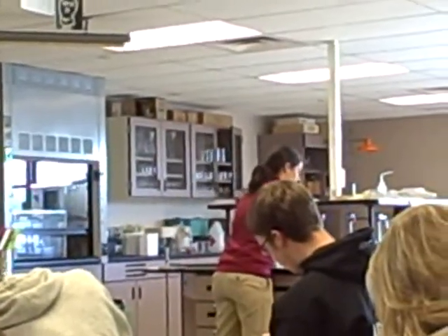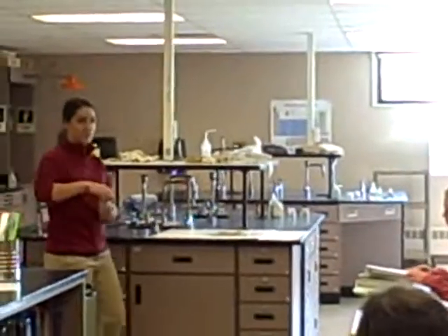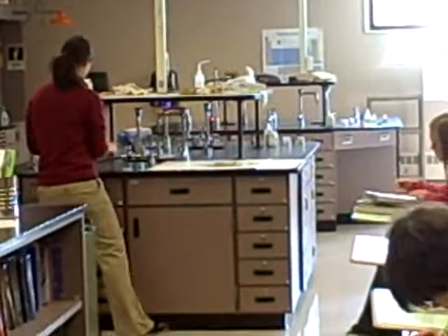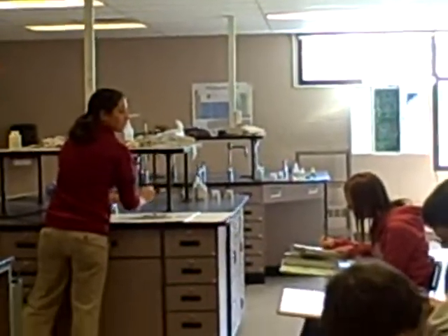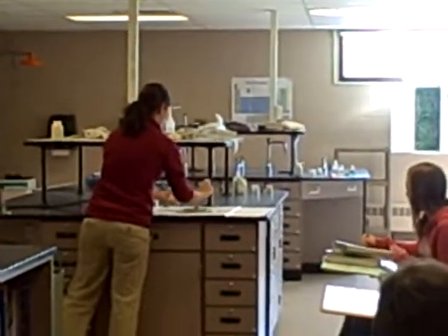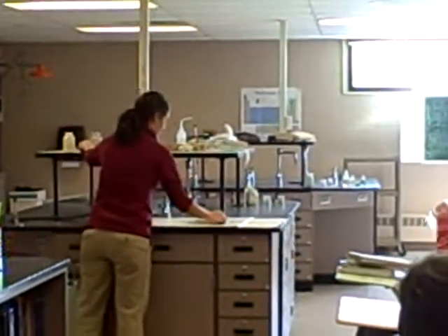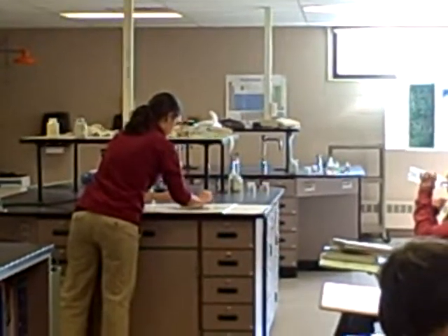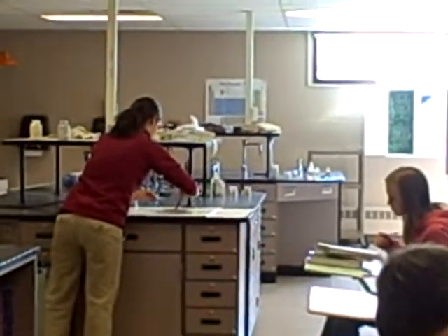And I'm just going to put a little pile on this plate. And zinc is this really, really dark gray. Okay, so write that down for zinc. So I'm just going to mix them up a little bit on here.